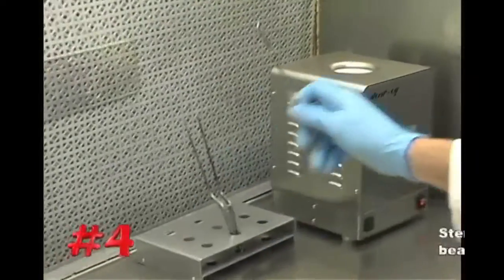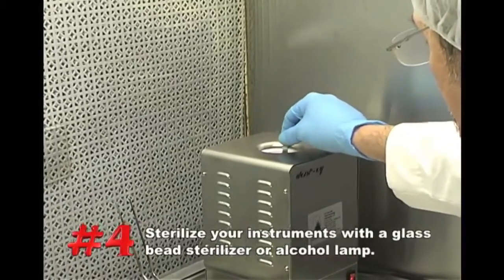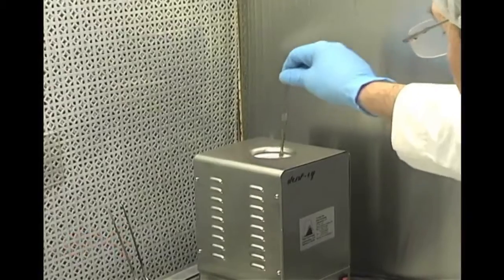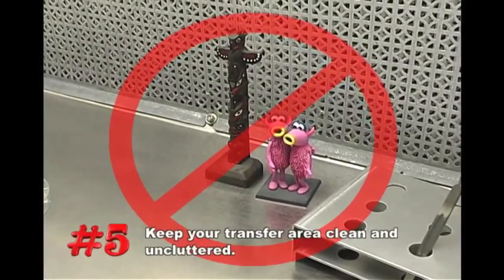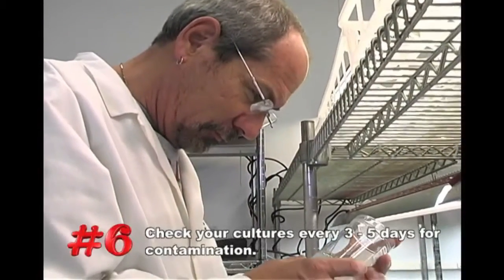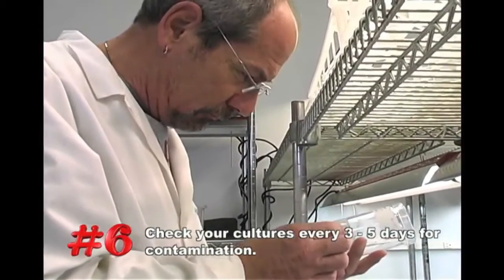4. Use a glass bead sterilizer or alcohol lamp to flame your transfer instruments between transfers. Remember to allow the instruments to cool between transfers. 5. Keep your transfer area clean and uncluttered. 6. Check your cultures every 3 to 5 days for contamination. Discard all contaminated cultures to prevent cross-contamination.